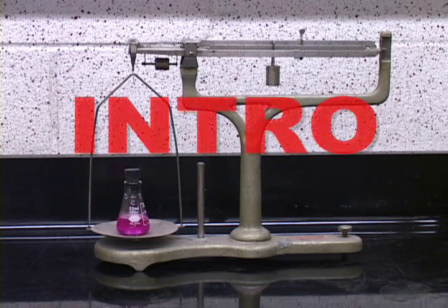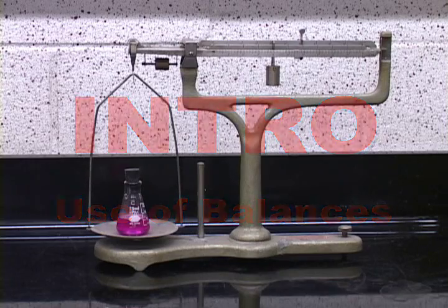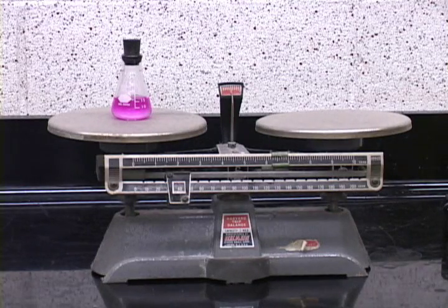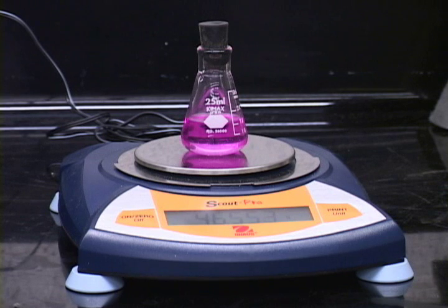Welcome to the General Chemistry Laboratory. In this first experiment, called Intro, you will be introduced to the use of balances for the measurement of mass. There are many different types of balances. And in this course, you'll be using at least 4 different types throughout the semester.